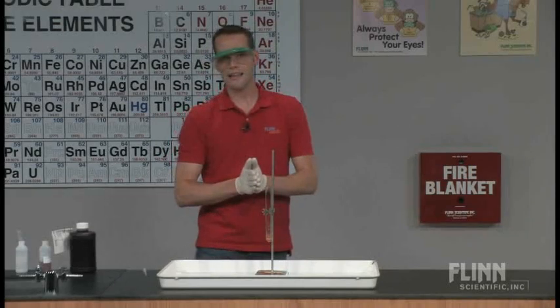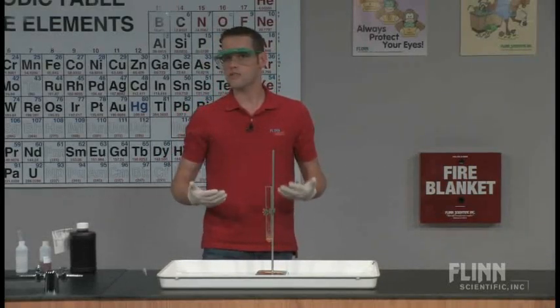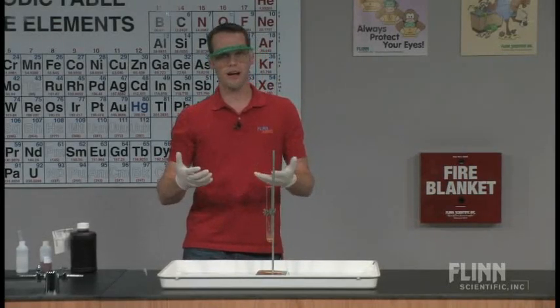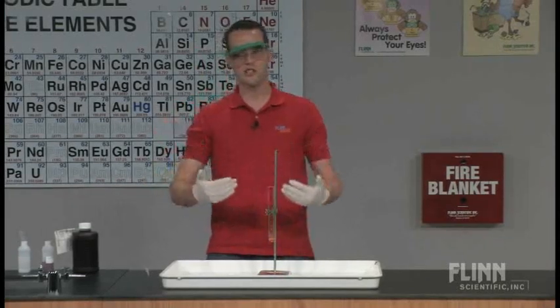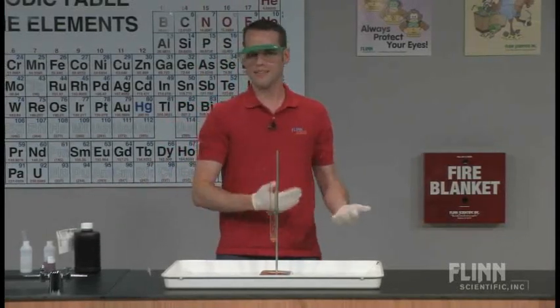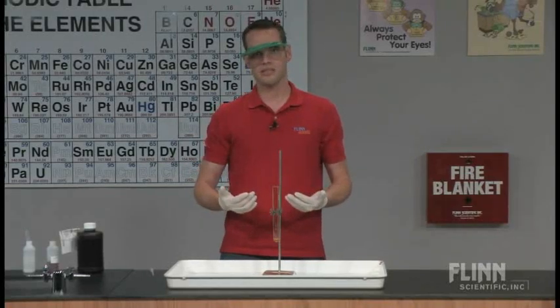The interesting thing about a catalyst though is that catalysts aren't used up as part of the reaction rate or the reaction process. So if a catalyst isn't consumed, it's put back at the end of the chemical reaction, I should be able to use this again.